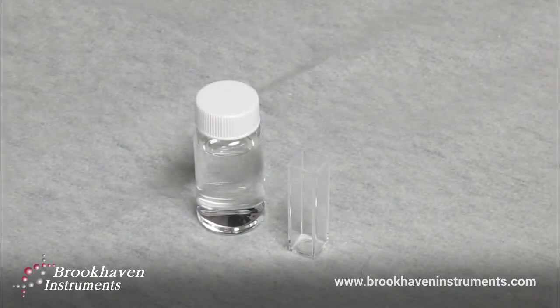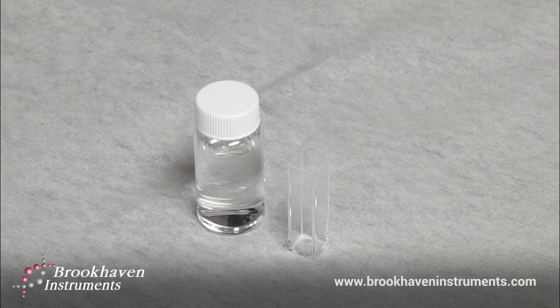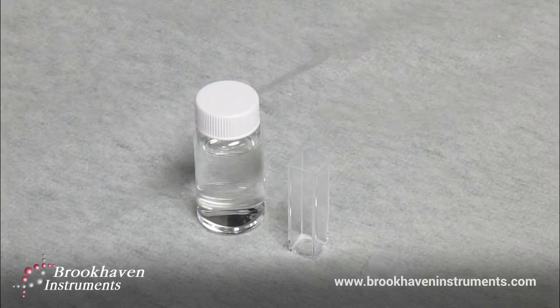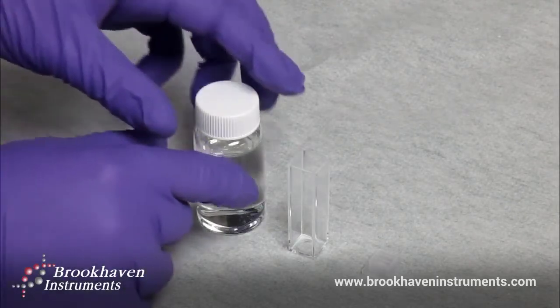I'm going to work through a sample of lysozyme in one times PBS today. The appropriate amount of lysozyme for the preparation of this sample was already measured and the PBS diluent was properly filtered to ensure no dust or contaminants are due to dirty diluent. As well, all vials and cuvettes were rinsed thoroughly prior to mixing.